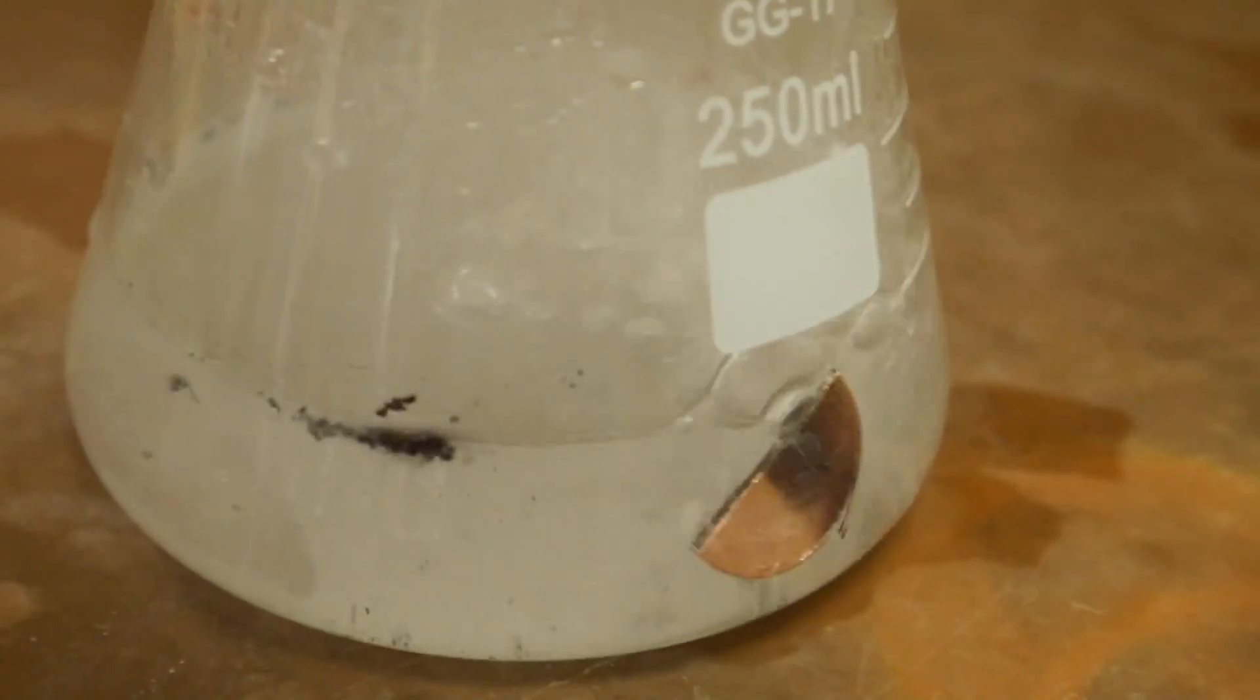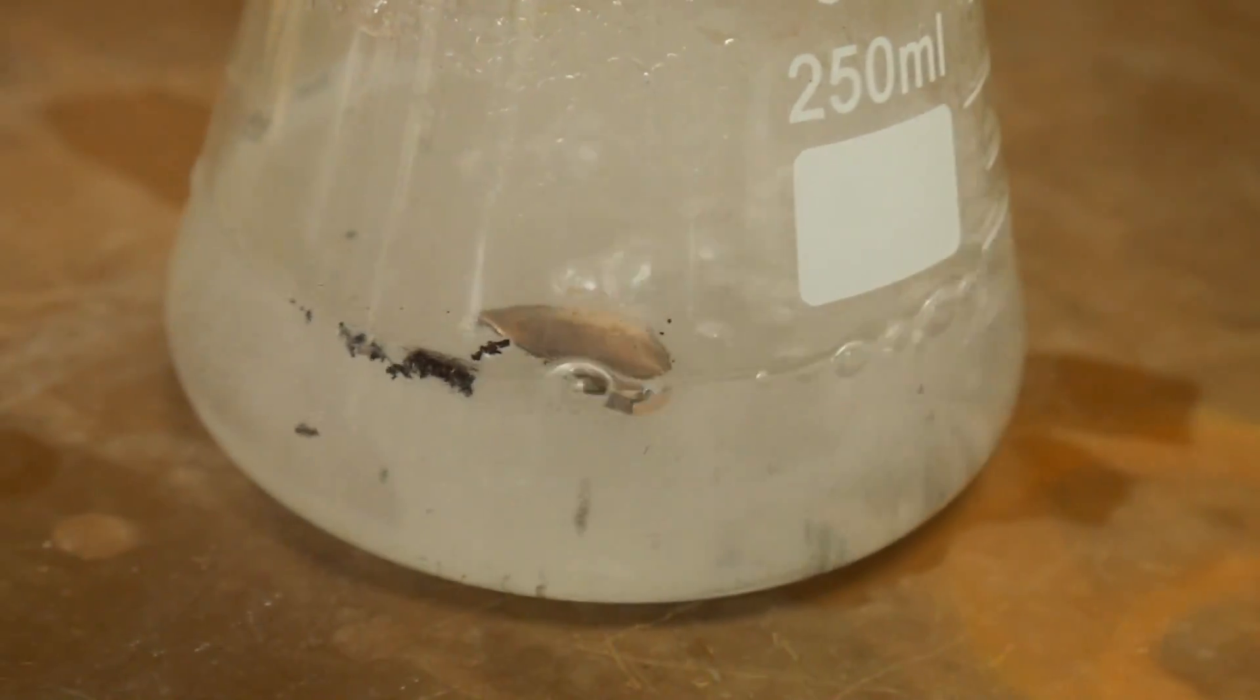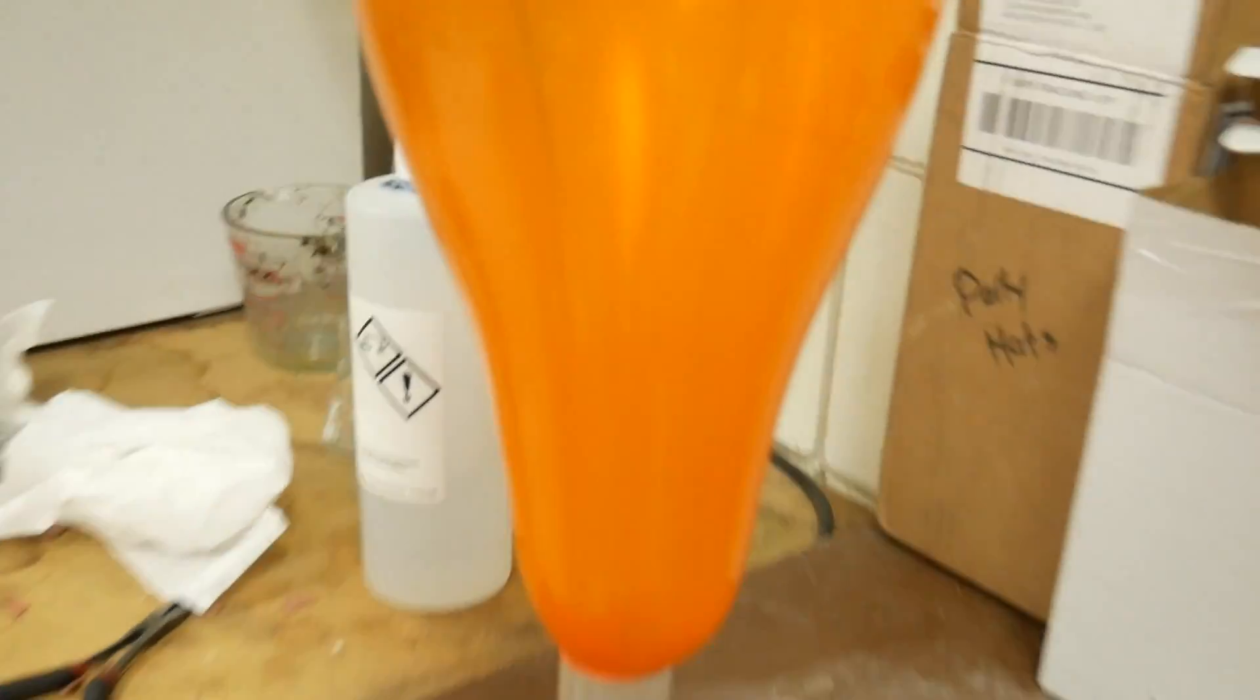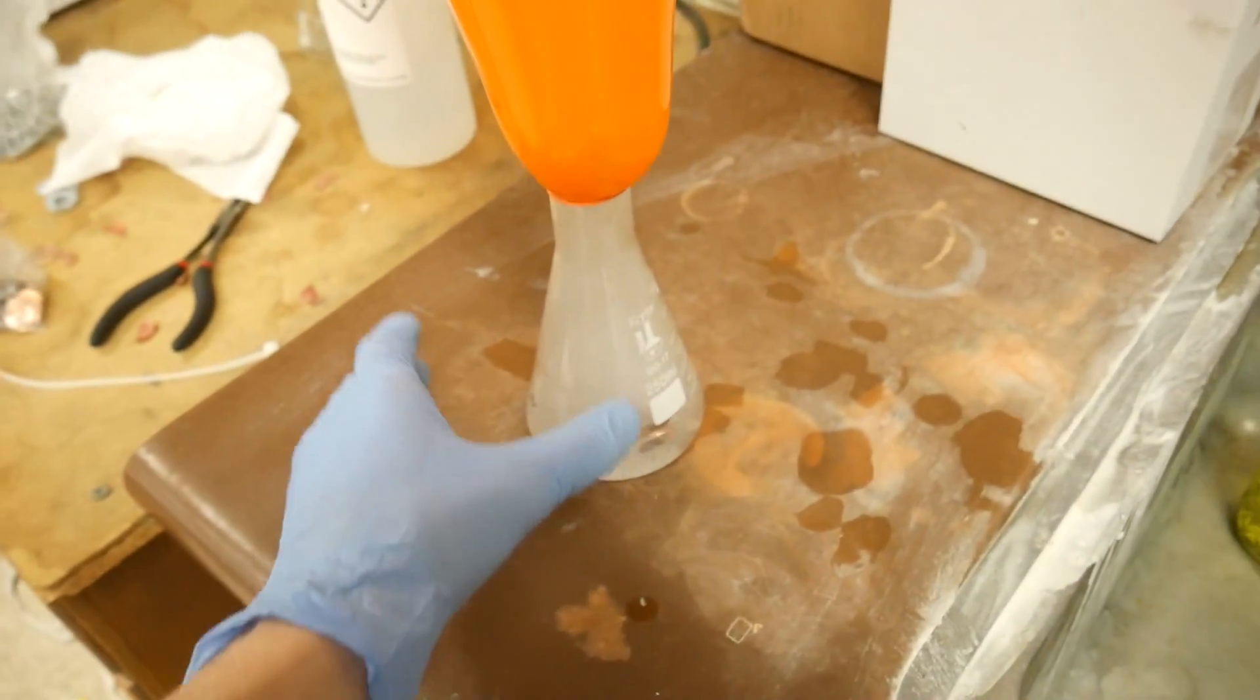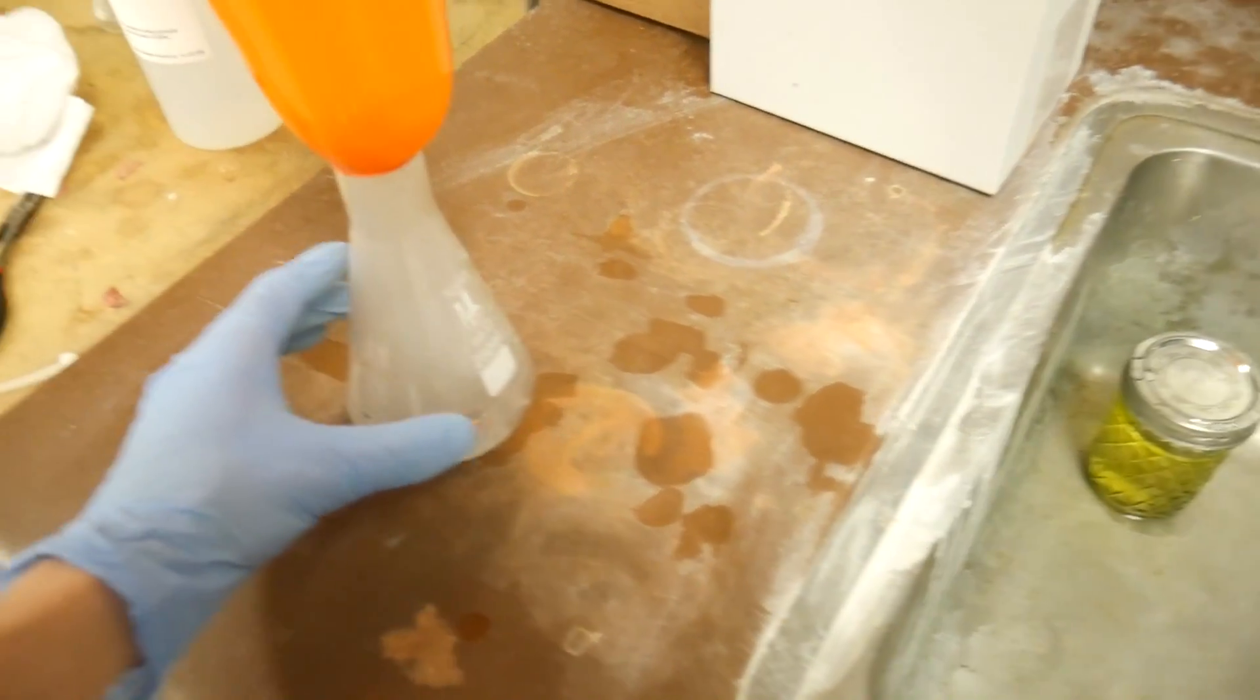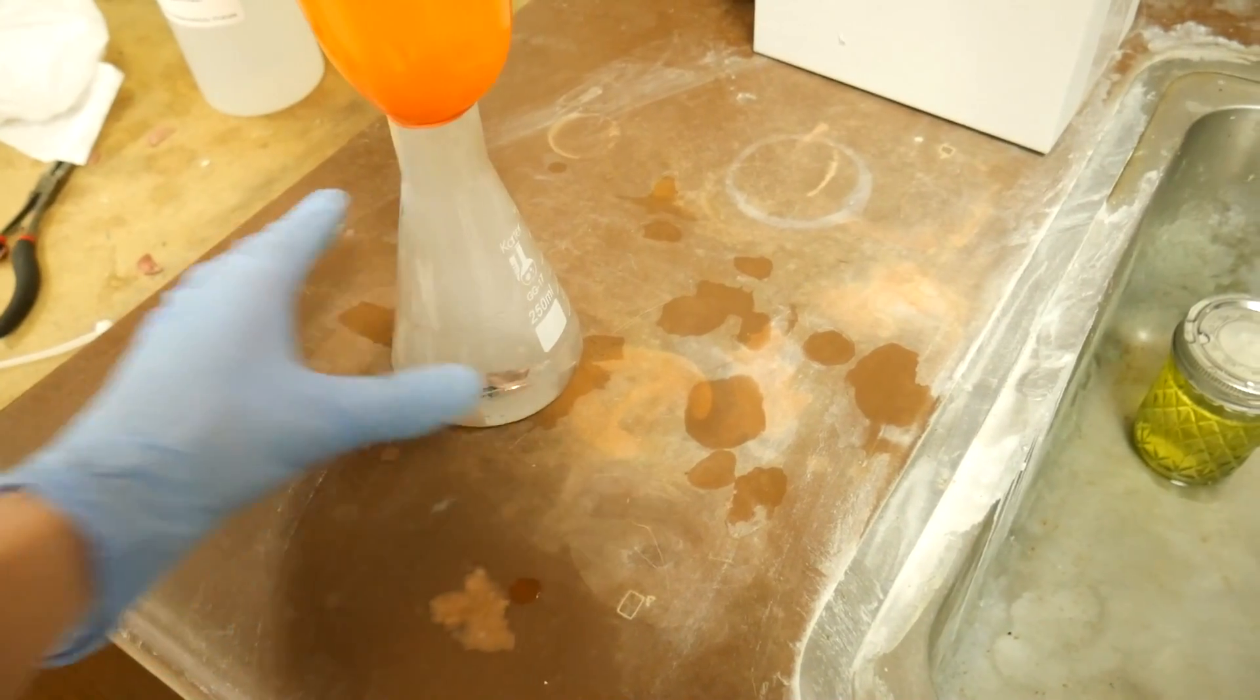So we can see the zinc from the pennies violently reacting with the hydrochloric acid. That is the zinc dissolving from inside the pennies. And the bubbles that we see are the hydrogen gas being created, and those are inflating this balloon. The hydrochloric acid itself is a... oh wow, it's really hot. Yeah I should mention that this is an exothermic reaction. So it does get pretty hot.